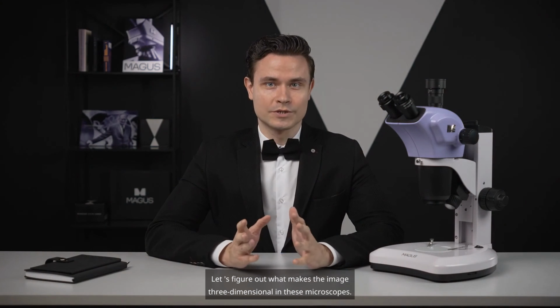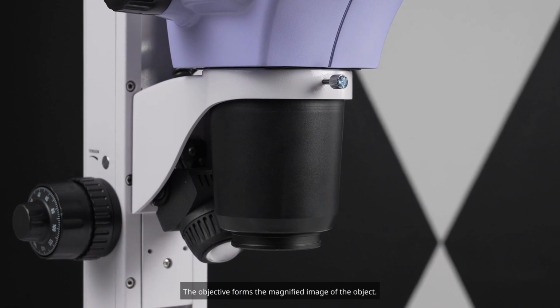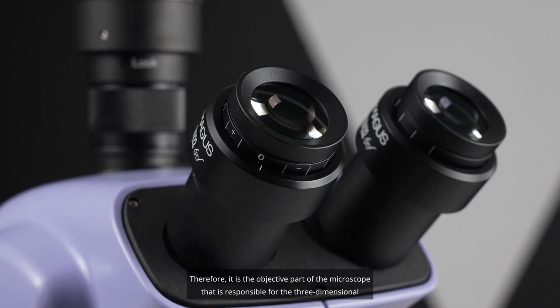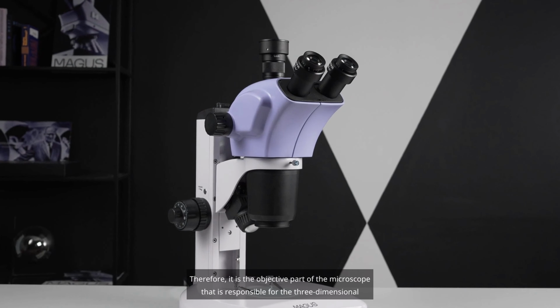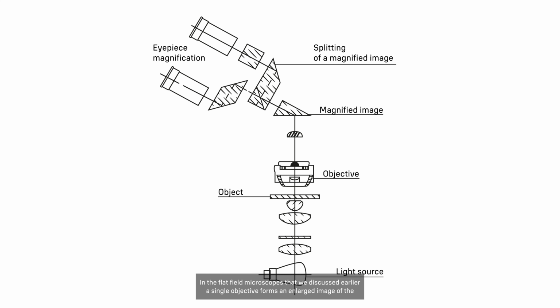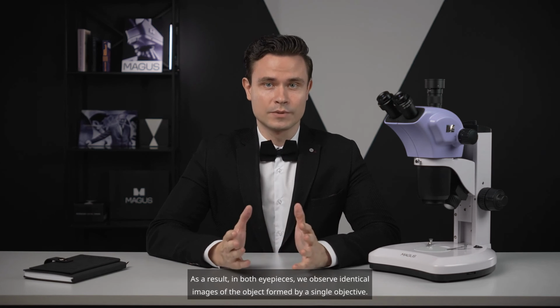Let's figure out what makes the image three-dimensional in these microscopes. The objective forms the magnified image of the object. The eyepiece only magnifies the image created by the objective. Therefore, it is the objective part of the microscope that is responsible for the three-dimensional observation of the object. In the flat-field microscopes that we discussed earlier, a single objective forms an enlarged image of the object. The prism of the binocular visual attachment duplicates this image, while the eyepiece magnifies it. As a result, in both eyepieces, we observe identical images of the object formed by a single objective.